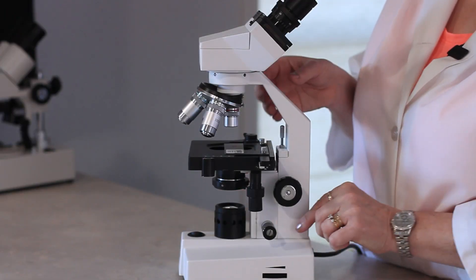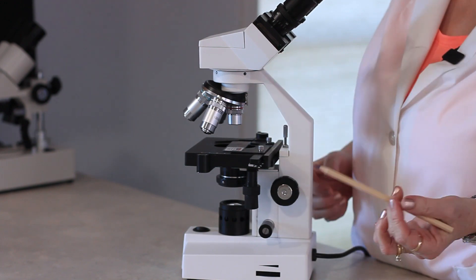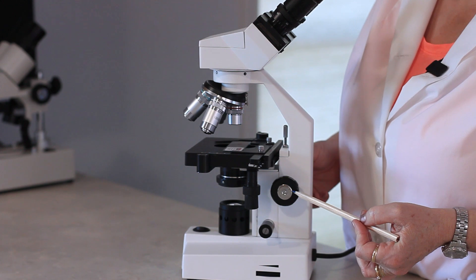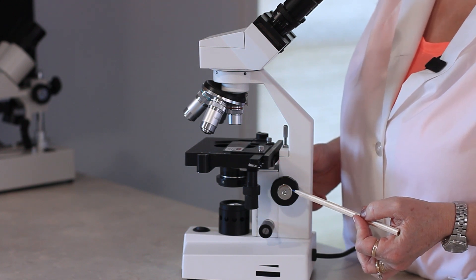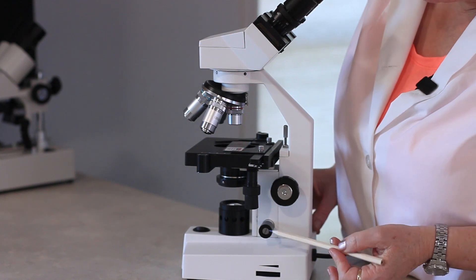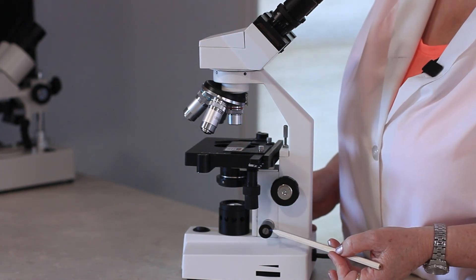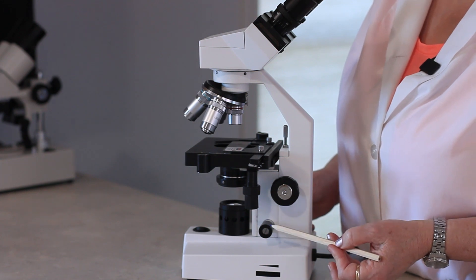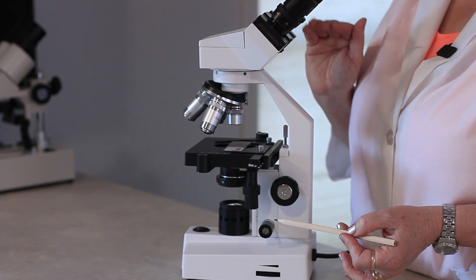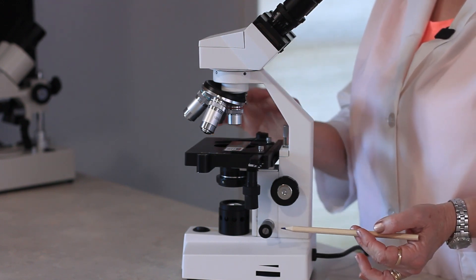We have what we are going to be using to bring our specimen into focus: we have our coarse adjustment knob. This only gets used on low power with the low power setting. And then we have our fine adjustment knob — that is for anything higher than low power. It moves the stage in very small increments so that you don't damage your lens or break your glass slide.